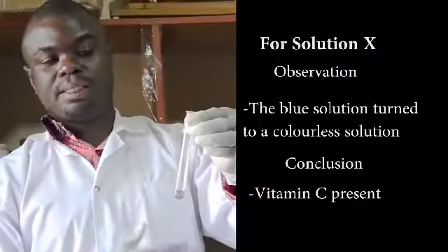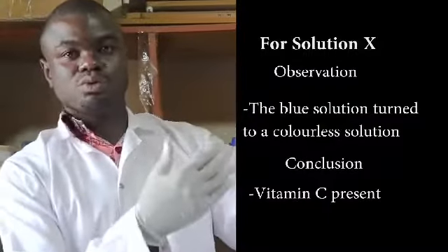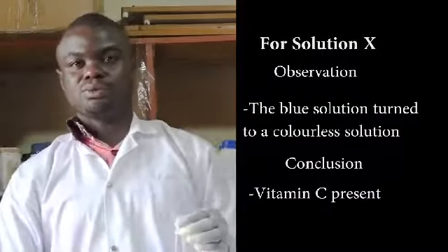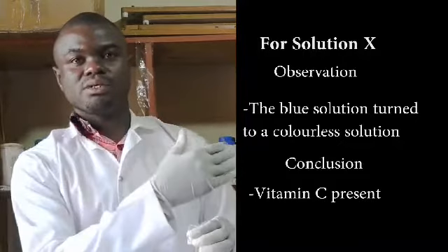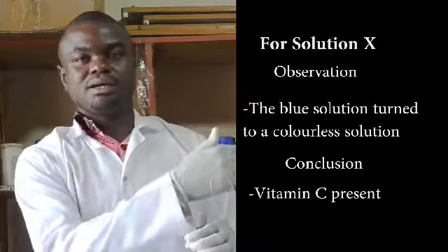So in my observation, I will say the blue solution turned into a colorless solution. And the conclusion is vitamin C present.